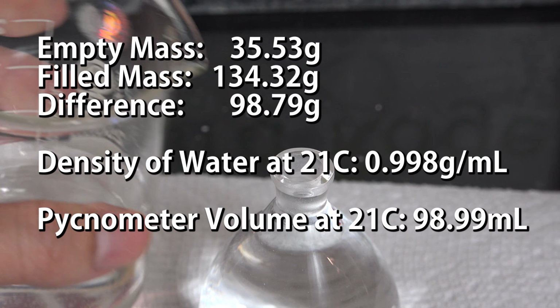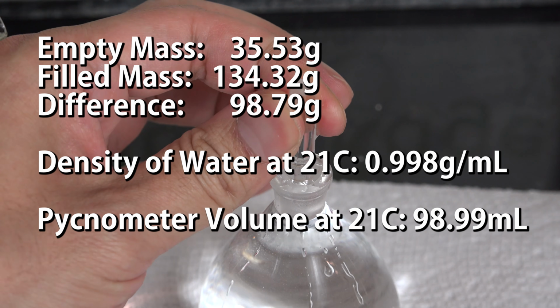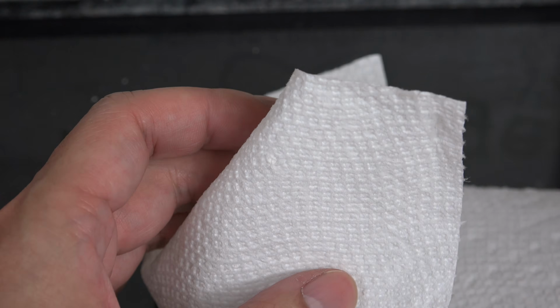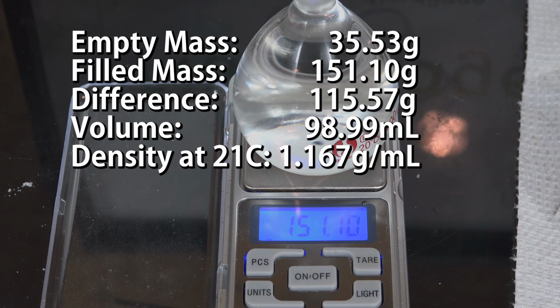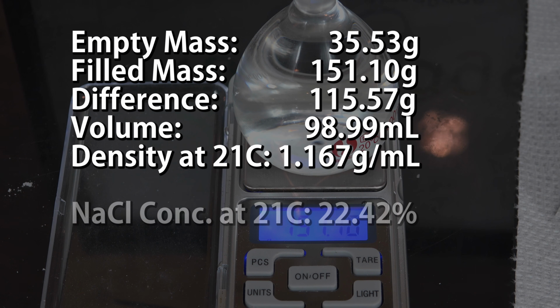Now that we know the exact volume for this temperature, we've calibrated and can now measure the density of an unknown liquid. We just empty and fill the pycnometer with it, dab off the excess, and measure the mass. We subtract the empty mass to find the liquid mass, and then divide it by the volume we found earlier. And that is the density of our unknown liquid at this temperature. This is actually sodium chloride solution of unknown concentration. But now that I know the density, I can consult a density-concentration table to find it.